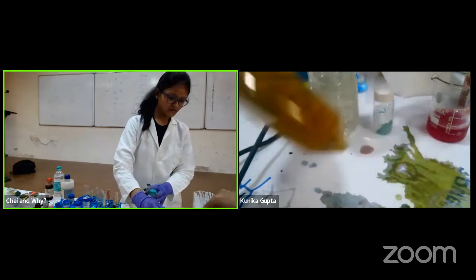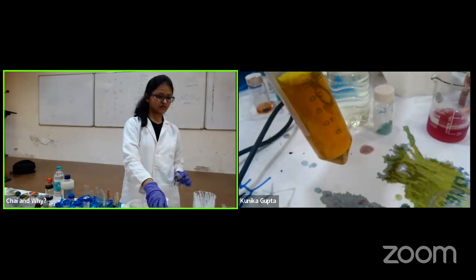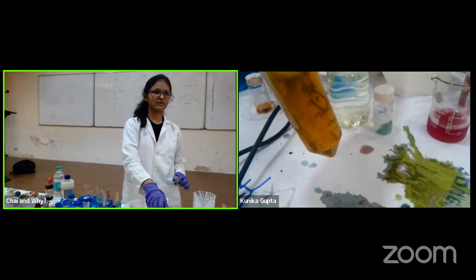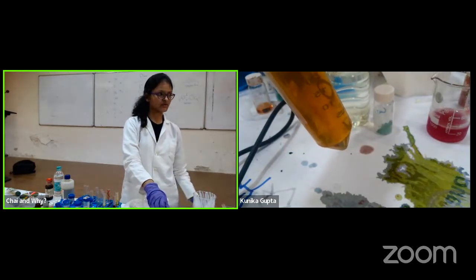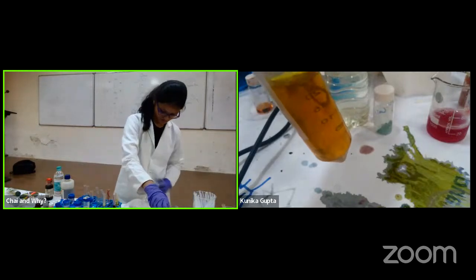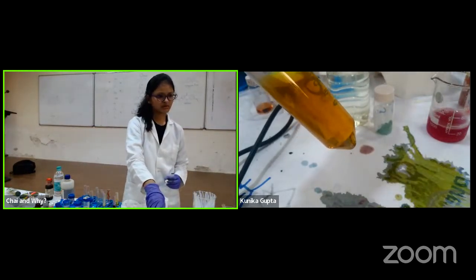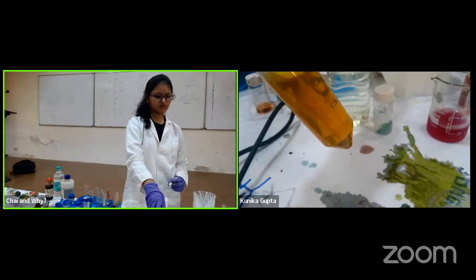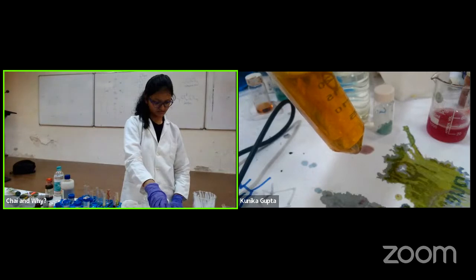Okay. Now, if you observe, I'll stop for a while and see. Do you see the green changing its color? The blue changed to green, and now it is switching to the other color, which I hope is visible. I don't know if it's visible on screen. It's now yellowish, reddish yellowish. Yes. So we'll wait for a while and see if the color changes again.